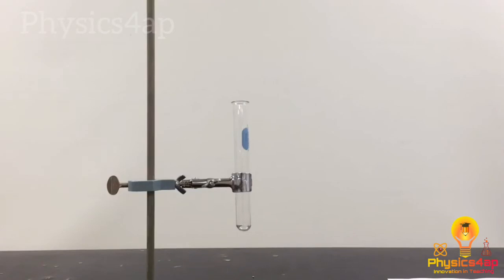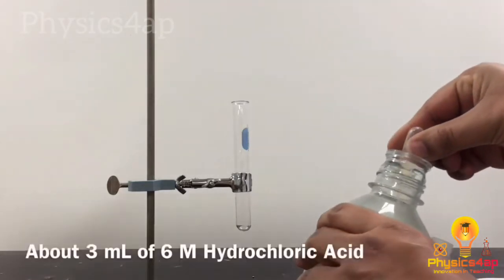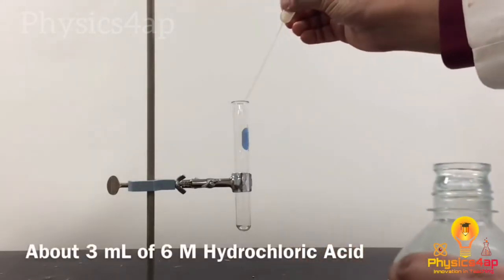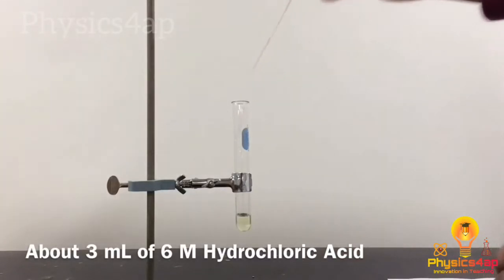Welcome back to chemistry. This is Jeremy Krug with another chemical reaction. This time I have a test tube set up here, and I'm going to add just a few milliliters of hydrochloric acid.